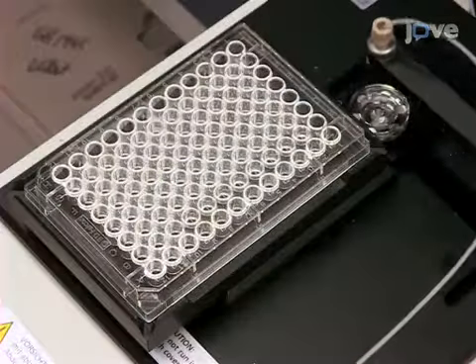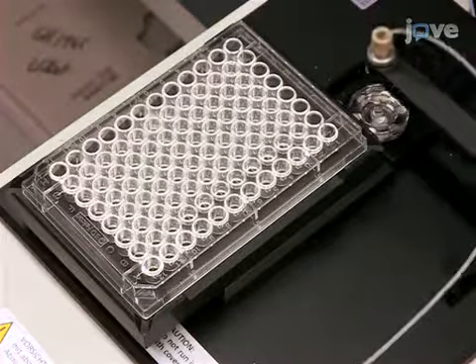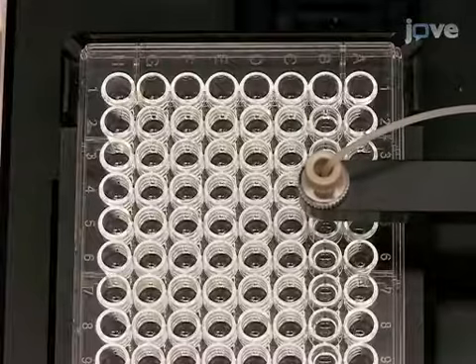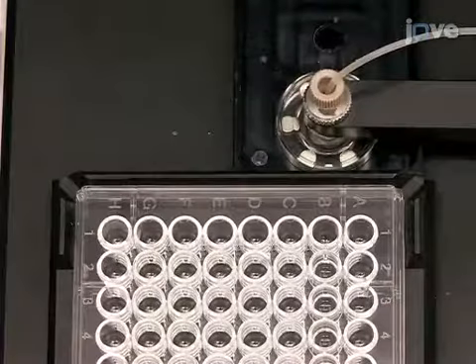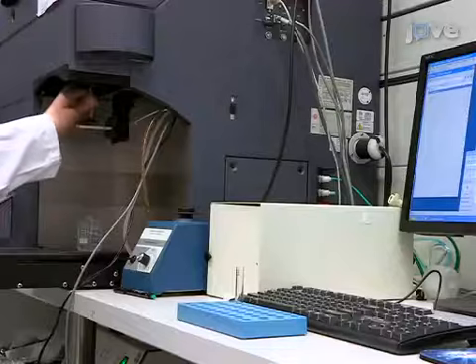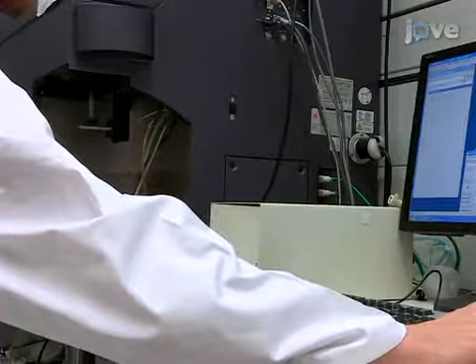A 96-well reader on the flow cytometer allows performing T-cell infection, differentiation, fixation, and staining in the same 96-well plate, providing an efficient workflow for parallel analyses of multiple conditions, but the analysis can also be performed in standard FACS tubes.